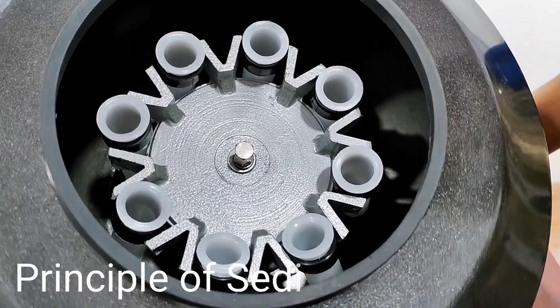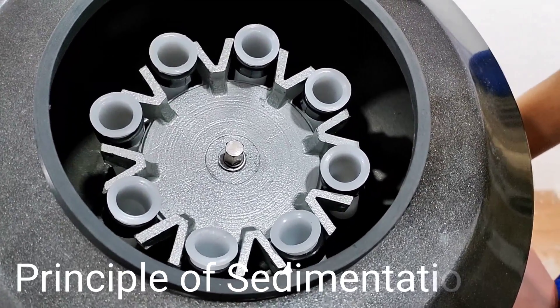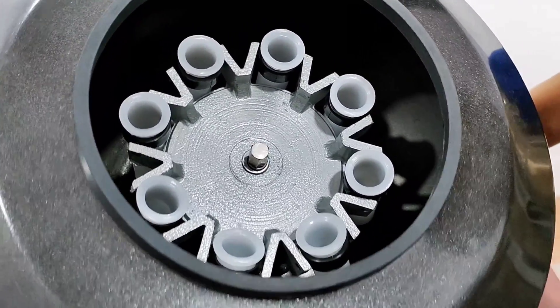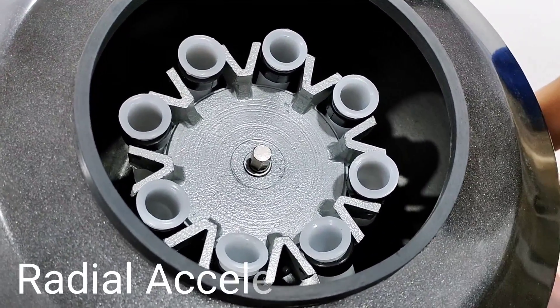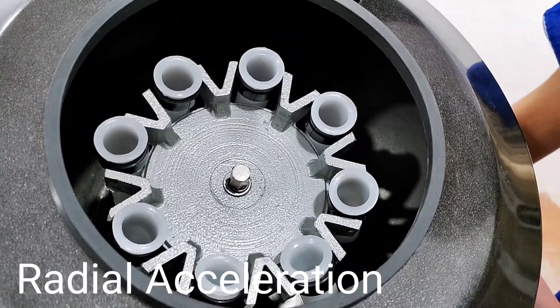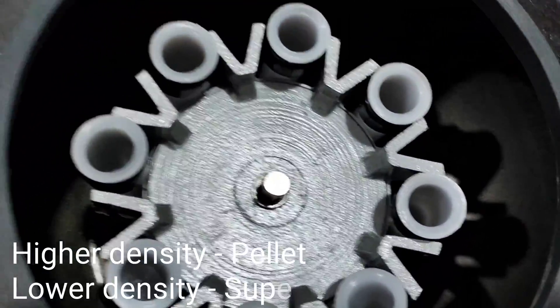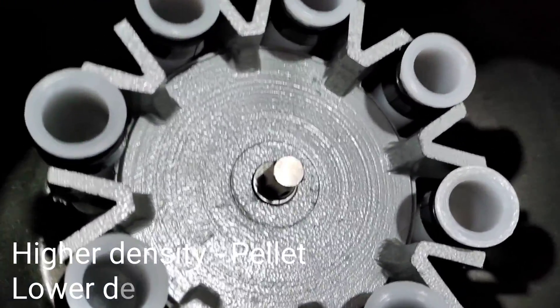The main principle of the centrifuge is sedimentation. During sample analysis or calibration, at high rotation, the high-density particles will settle down due to radial acceleration and the lower-density particles will settle on the upper layer. The higher-density particles are called the pellet and the lower-density particles are called the supernatant.